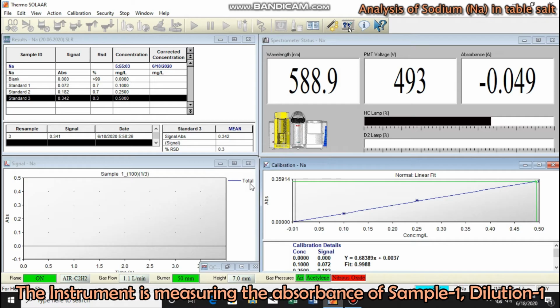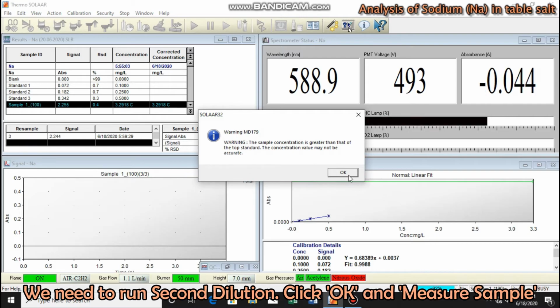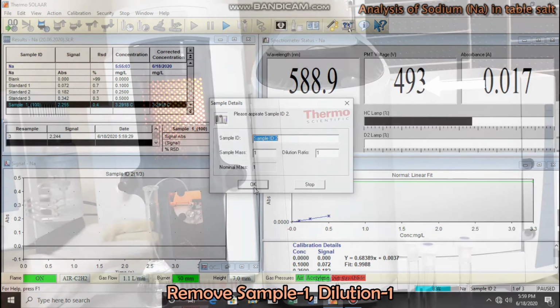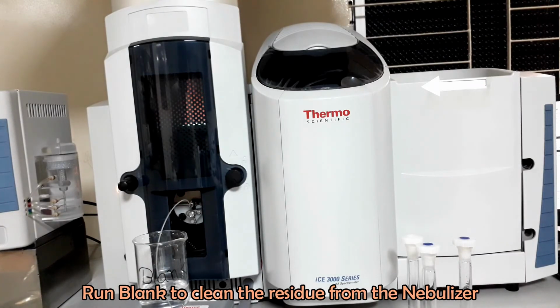The instrument is measuring the absorbance of dilution 1. A warning dialog box appeared which tells us the sample contains a higher concentration of sodium than any of the standards used to make the standard curve. This means we need to use a more diluted sample to get an accurate result. Run the diluent or blank to clean the nebulizer channel, removing residues of the previous sample solution.